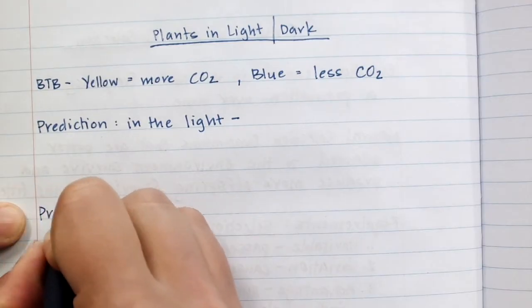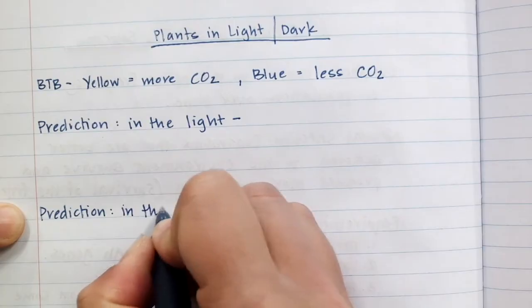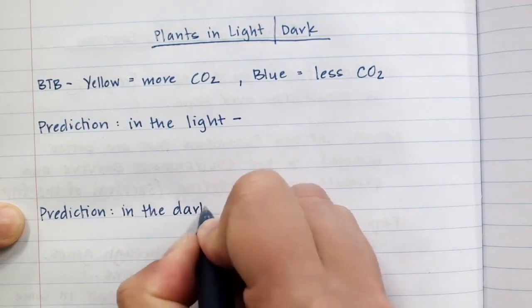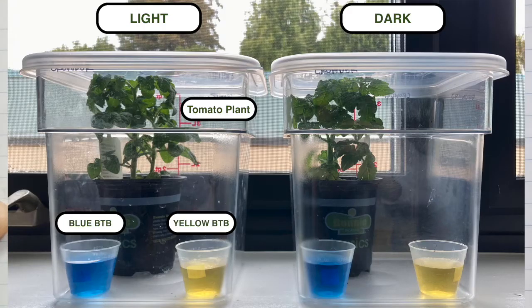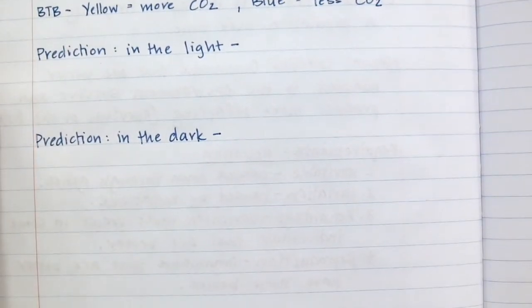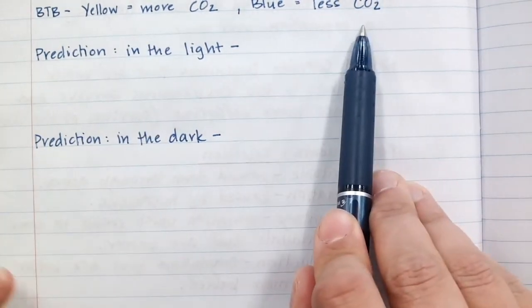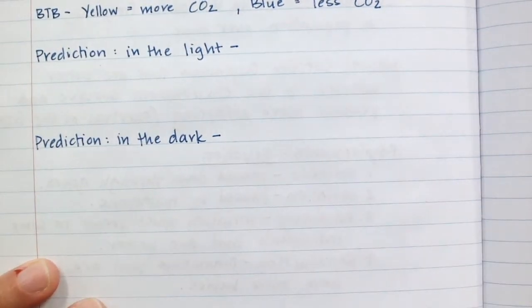So now we're going to make a prediction for in the dark. Same setup, blue BTB, yellow BTB, and a plant all sealed in a large container, but this time we're going to put the container in the dark. Now, what process is the plant going to be doing inside of our sealed container if it's in the dark? Is that process going to result in there being more CO2 in the air or less CO2 in the air?